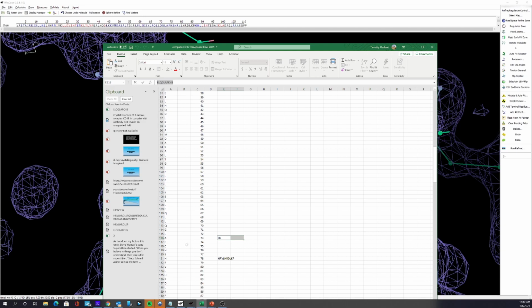And so I looked at residue 75, and it should be a cysteine. So what had happened is your colleague had not placed the cysteine there, but maybe just skipped it, and then added the rest of the sequence incorrectly. Now, to be perfectly fair, I actually transposed these in the actual sequence, but that shouldn't have made a whole lot of difference, except what's worse than transposing a particular residue, these 2 residues, is that you omit one. Then your sequence is completely out of whack.